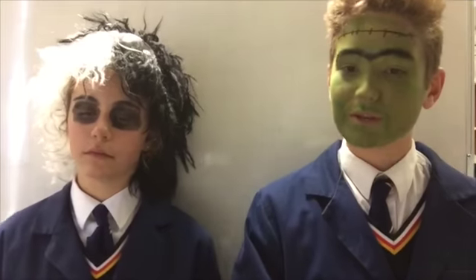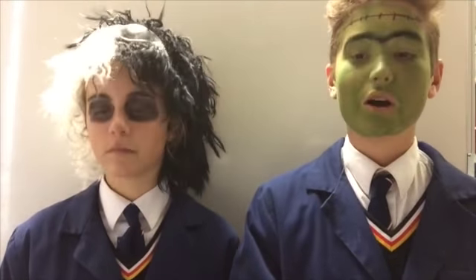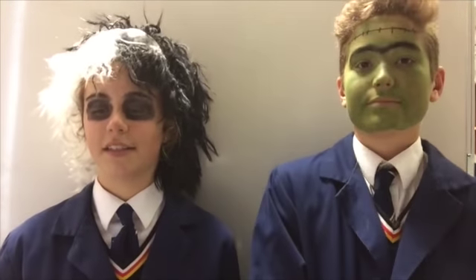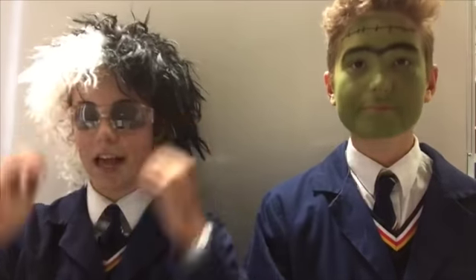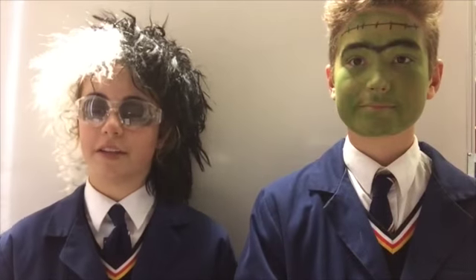The aim of the experiment is to successfully and safely complete the task of observing corrosion of different metals over a time period. To make sure you are safe while doing this experiment, wear safety clothing such as plastic glasses and a lab coat to prevent liquids containing corrosive metals from getting in your eyes.